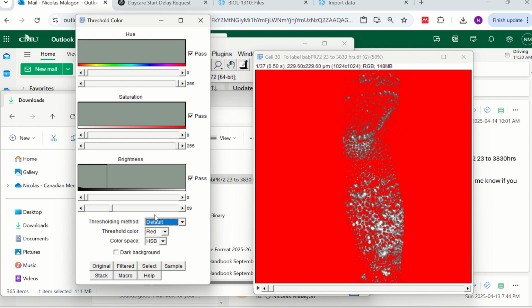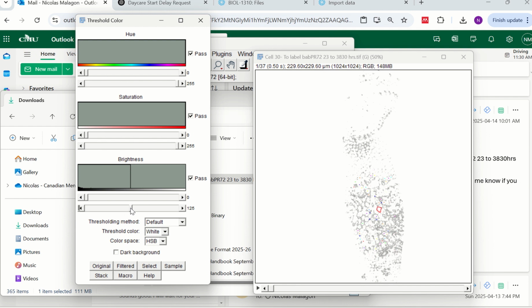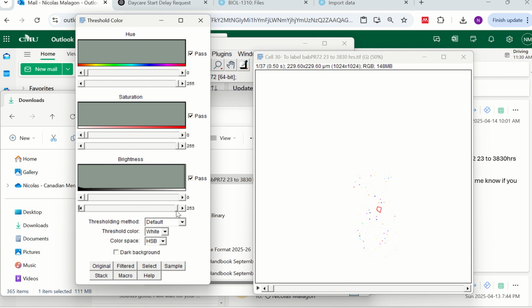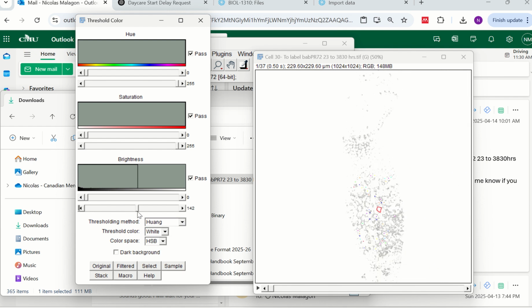Let's make it white, because what we need to remove is the white. Look, if you start moving the white here, you see what happens? It goes from full, all this dark thing that we don't need. Now if you move it and start increasing, 120, 136, you try to remove as much as you can. If you go too far, it will disappear. So you try here. Good. If you choose another method, many of them do the same thing with different calculations, but the idea is the same. The idea is to keep it like that. Again, if you go too far, it will go. If you go to 255, it will be completely white.